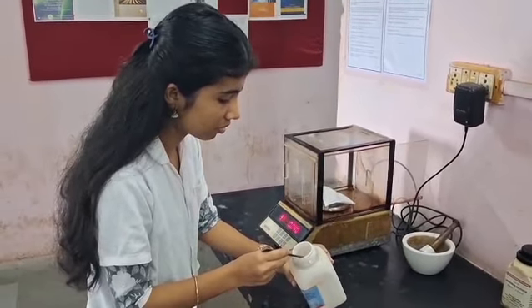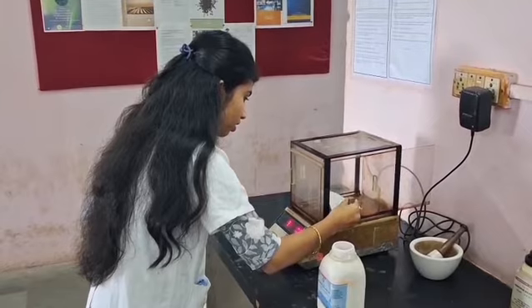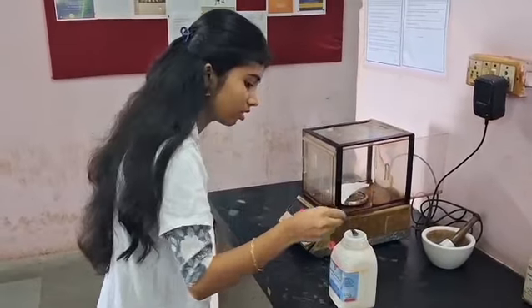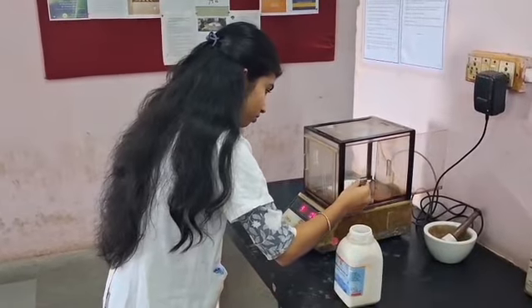There are 3 parts in this experiment. The first part is standardization of KMnO4. Second part is back titration. Third part is blank titration. Let's first do the standardization of KMnO4 solution by preparing 0.1 normal sodium oxalate solution.